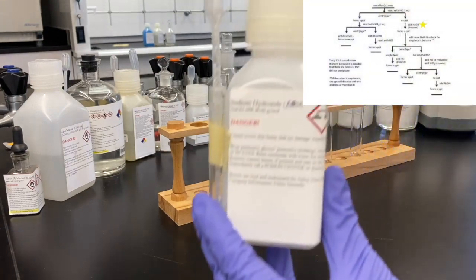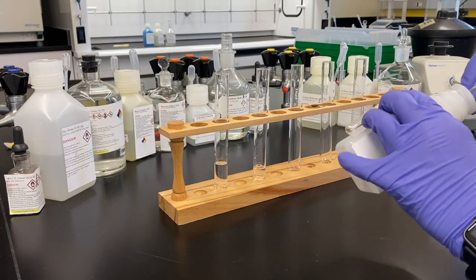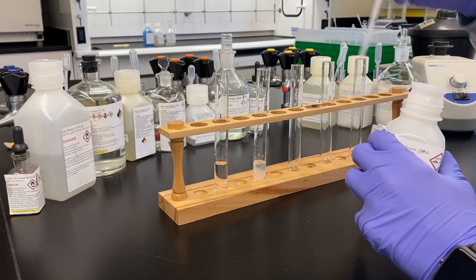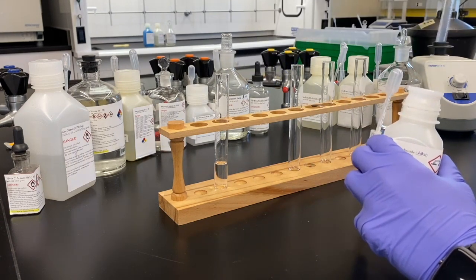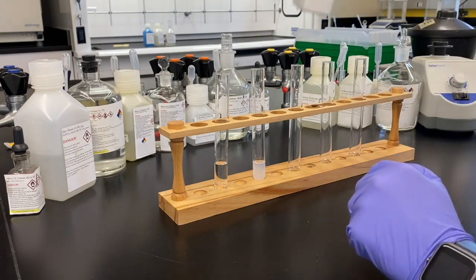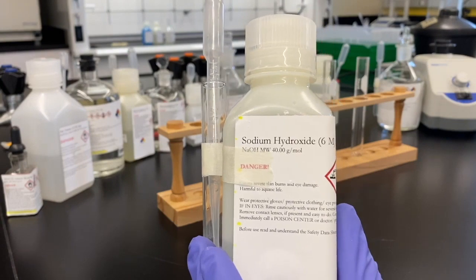Next step will be to add sodium hydroxide. It's the same concentration as the hydrochloric acid, so we'll need about the same amount to neutralize that acid, and then we'll add a little more to see if the precipitate forms. Starting to see something. It's looking cloudy, because not so much has been added yet. It may be that it goes away. Oh, it doesn't. It sticks around. Would that be a zinc hydroxide? Zinc hydroxide, yeah. If you recall from your solubility rules again, zinc hydroxide is insoluble.